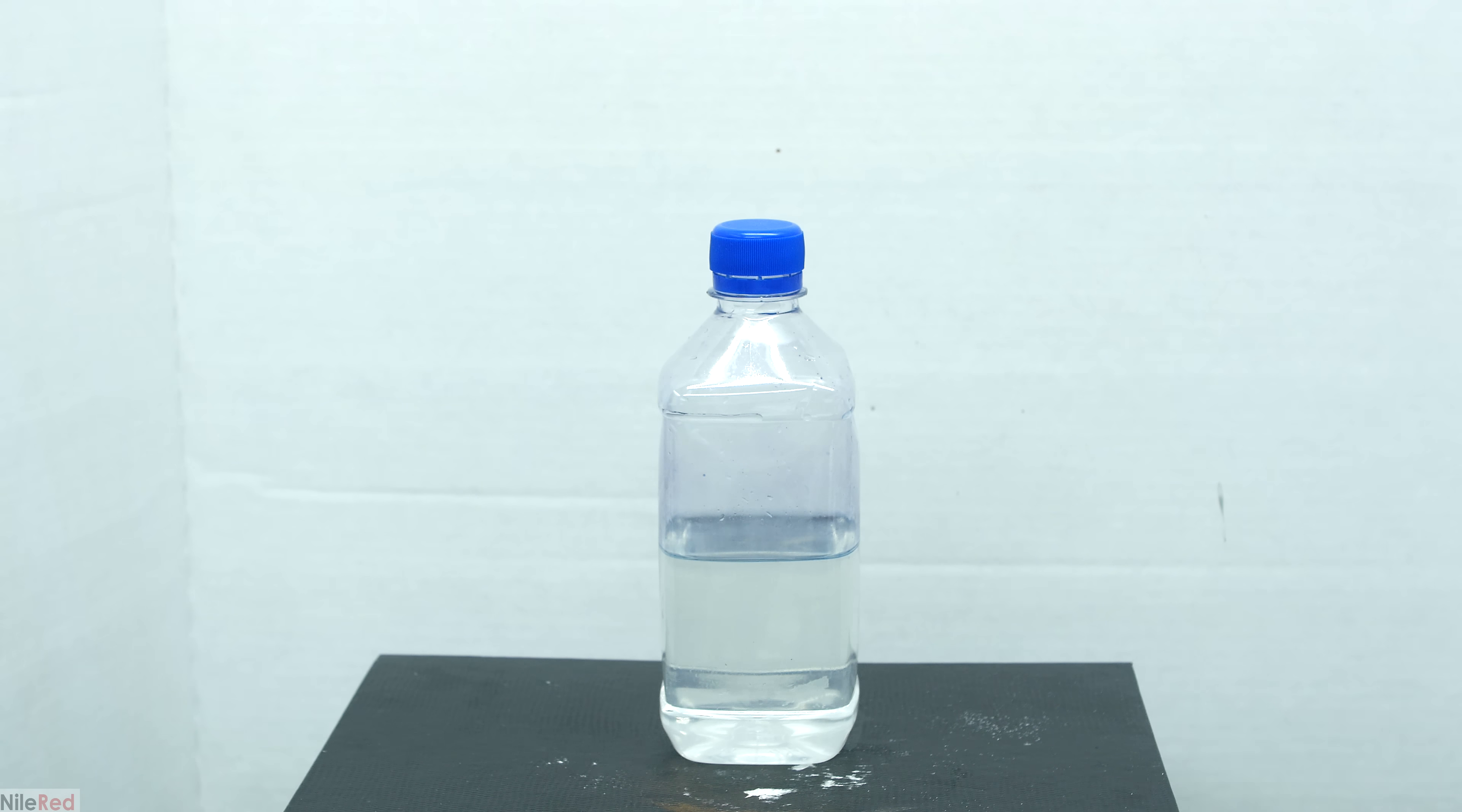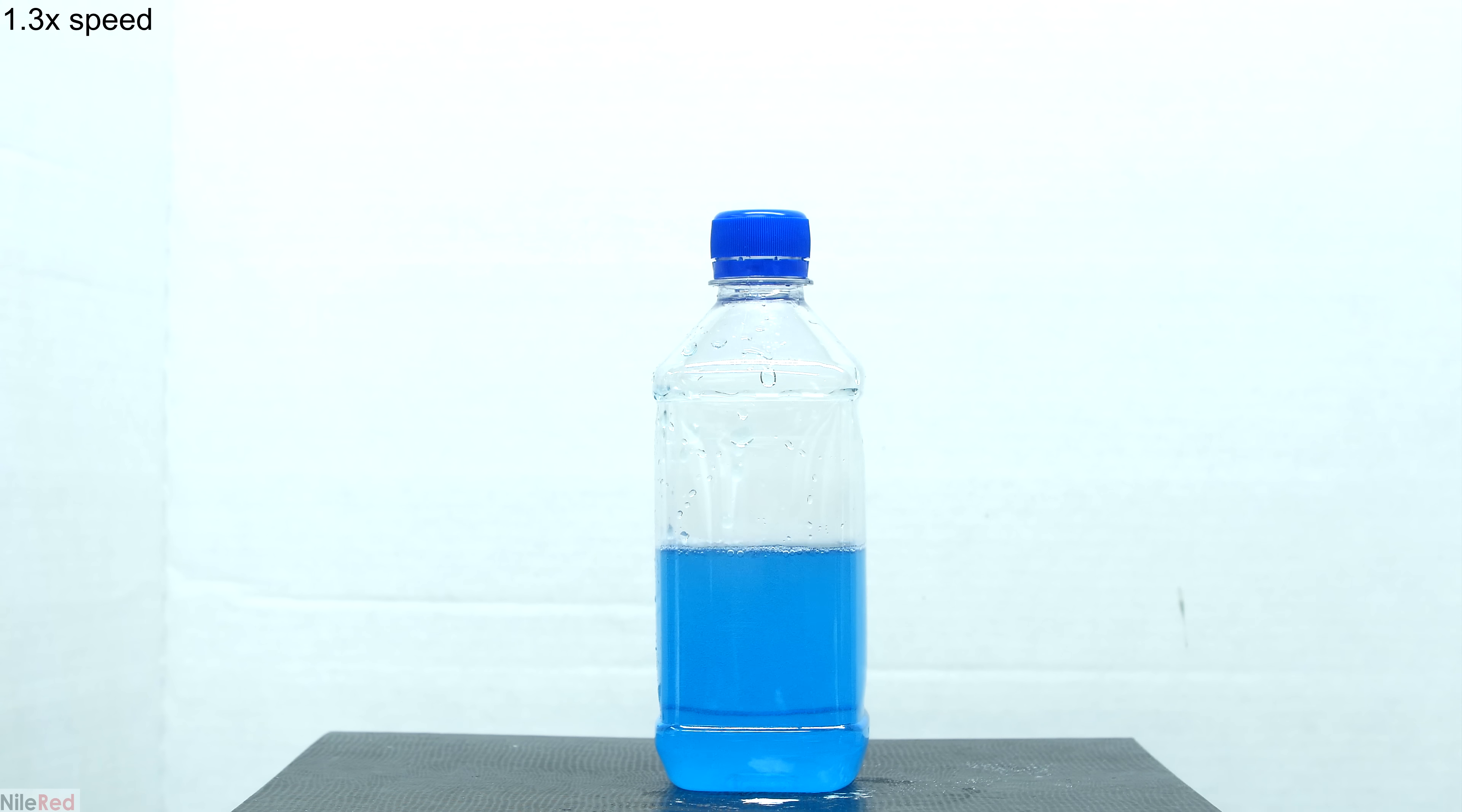The time that it takes for the solution to go back to colorless depends mostly on the temperature as well as the concentration of methylene blue, dextrose, and potassium hydroxide.